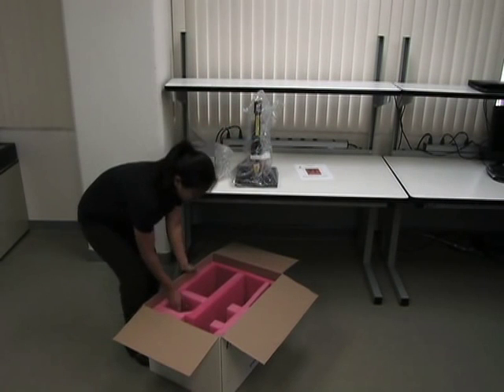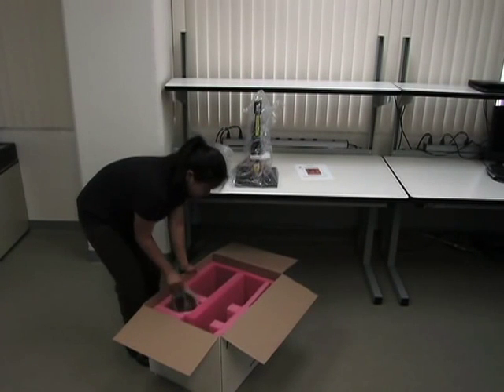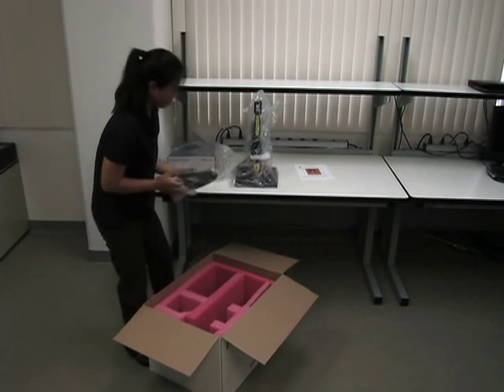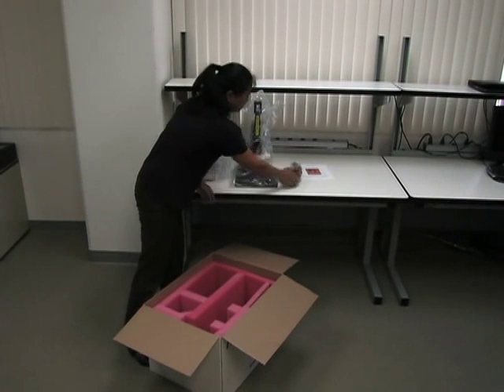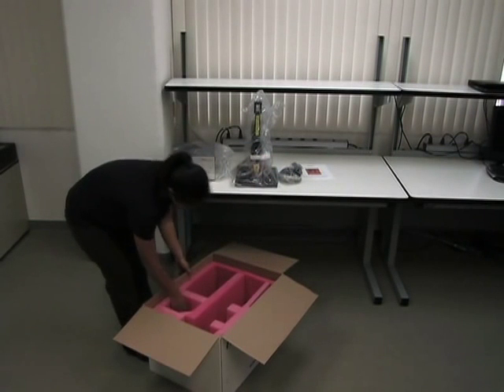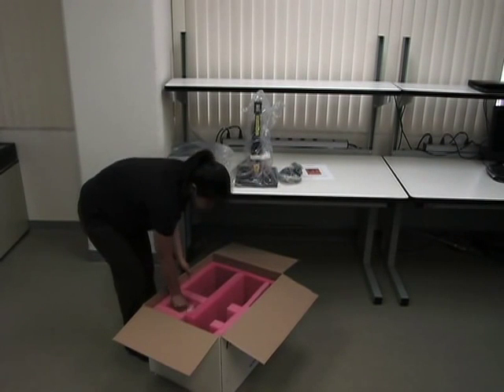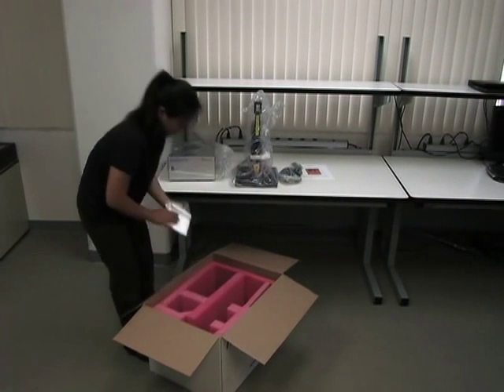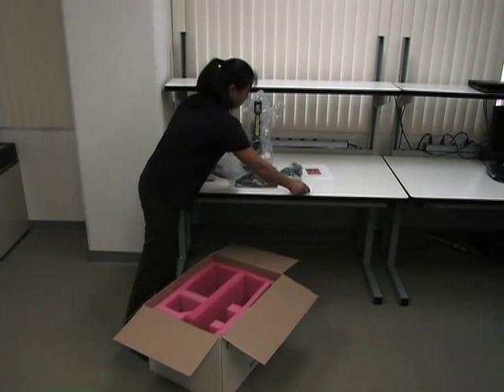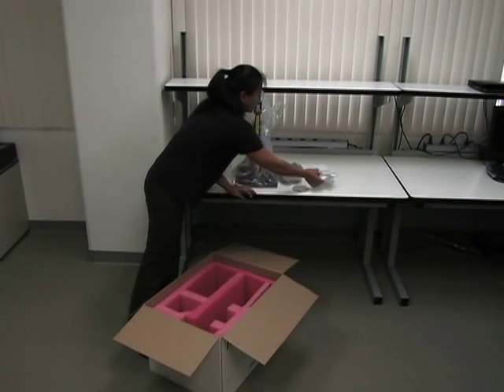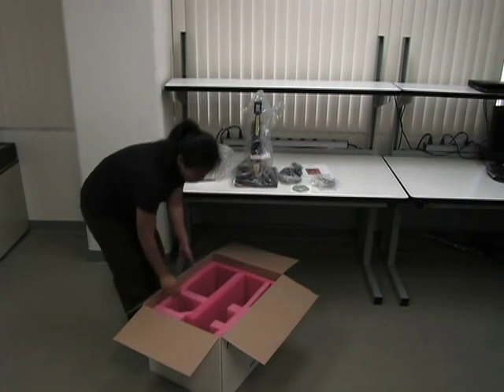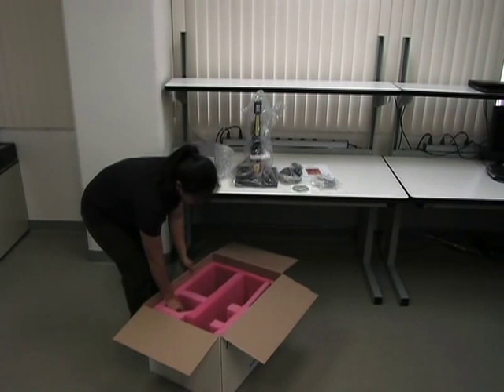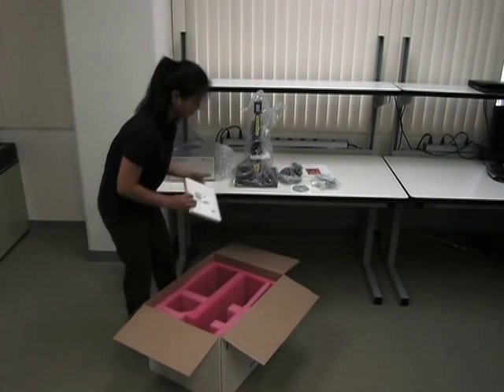Finally remove the power and connection cords, the software CD, spare light bulb and references, and the fiber optic cable.